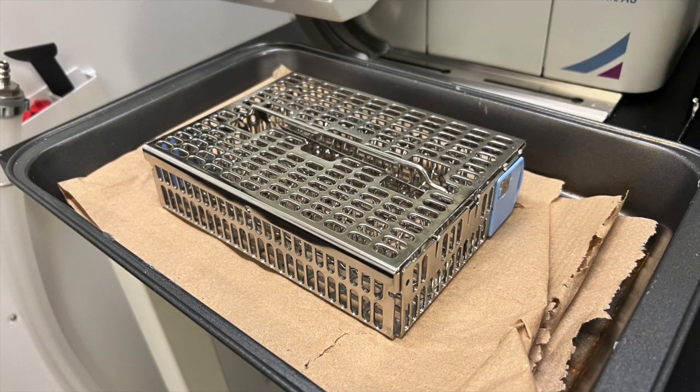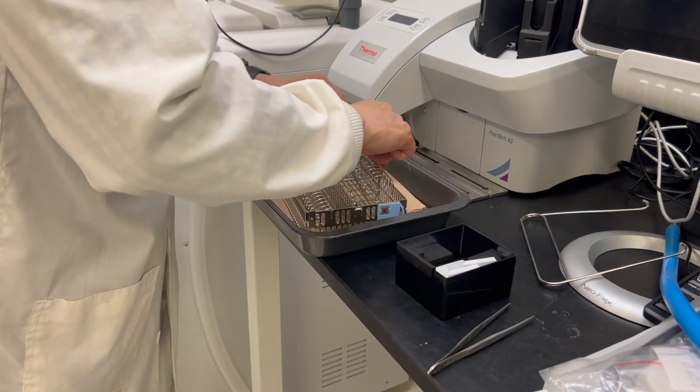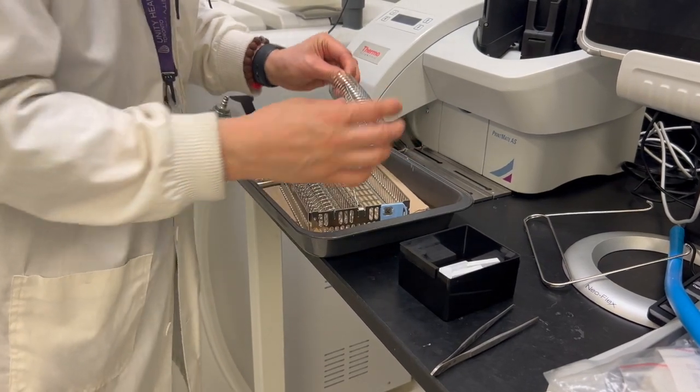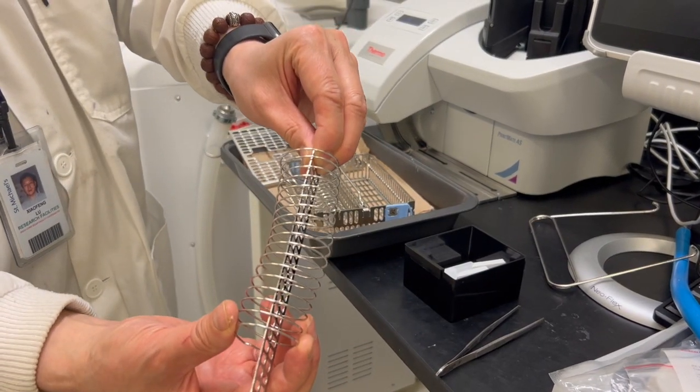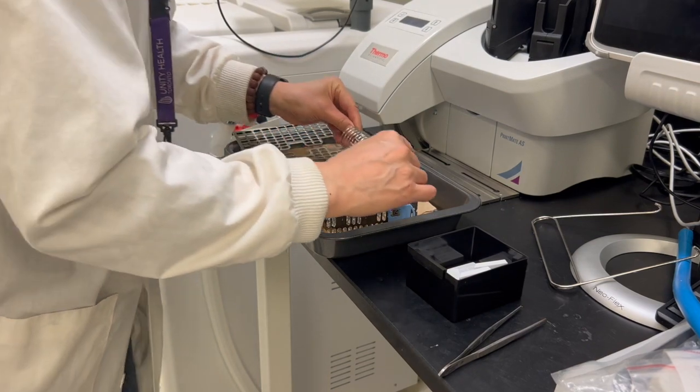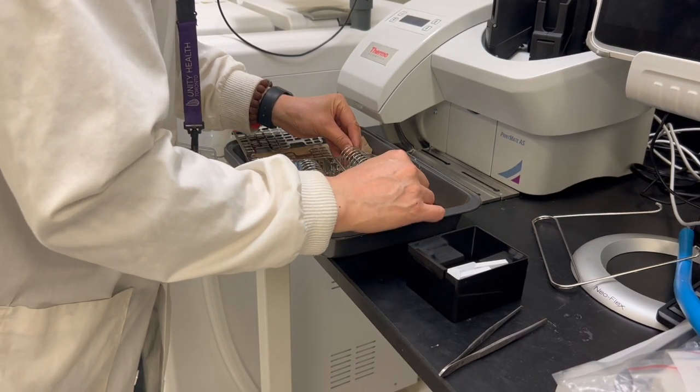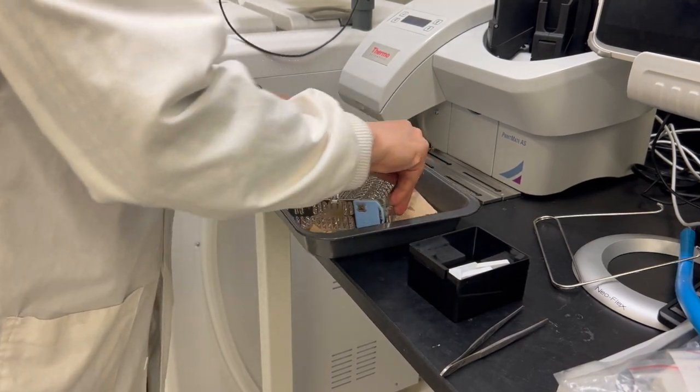This is a stainless steel cassette basket, which is compatible with most common cassette types. Please use these baskets during processing. Please do not put cassettes into the retort directly. This is the spring of the basket and the basket division board, which are used to align the cassettes in the basket accurately.